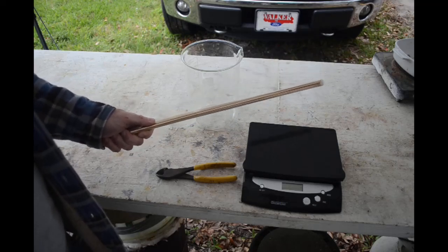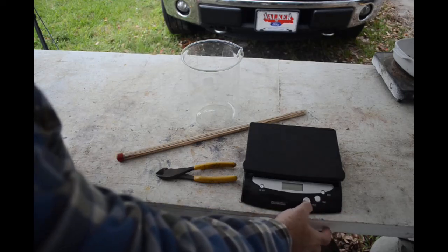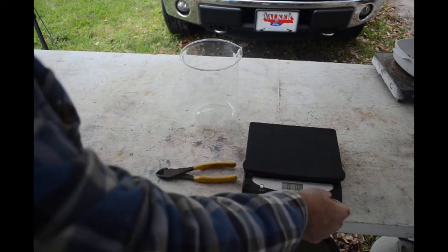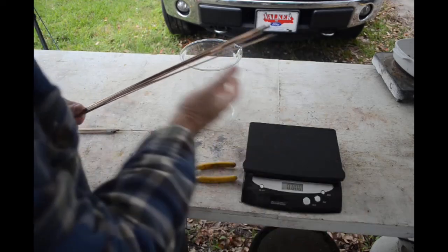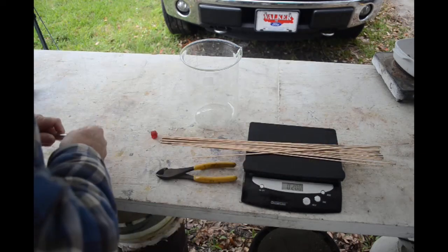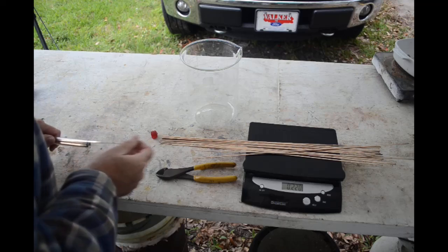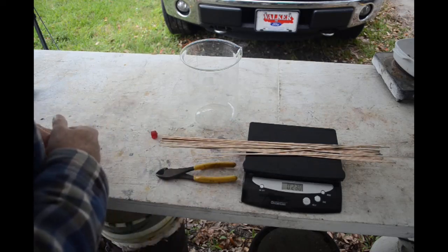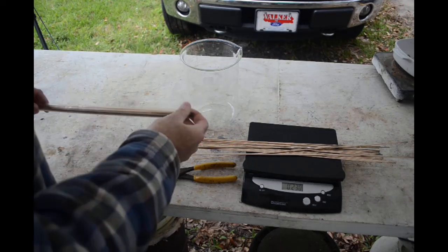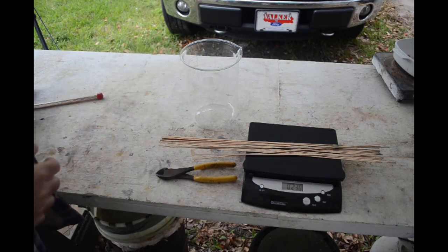There's a story of how I got this stuff — I'll tell you as we go along. I need to measure out a little over 200 grams. I've got my big scale out because that's above the limit of my little scale. Let me switch it to kilograms. There's 190... 200... 220. I'll throw one more on just to have a little cushion — we'll go 230 grams. That should give me well over one troy ounce of silver. I've still got about that much rod left in here. I can either do this again in the future, or hang on to it in case I need to do some brazing.